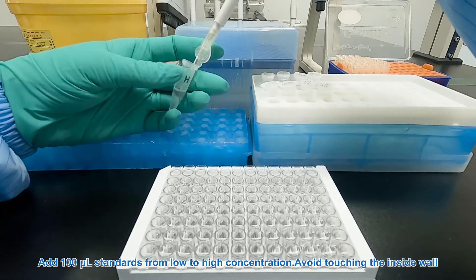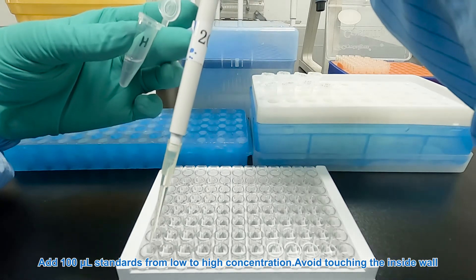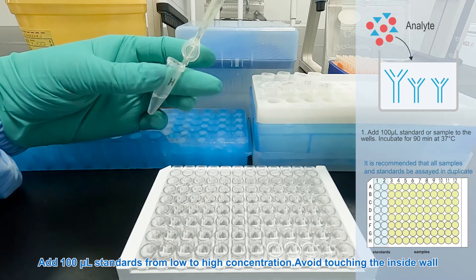Add 100 microliters standard from low to high concentration. Avoid touching the inside wall.